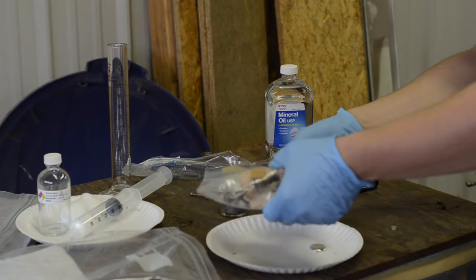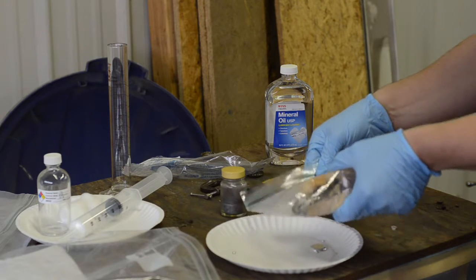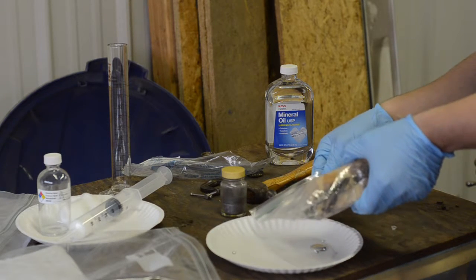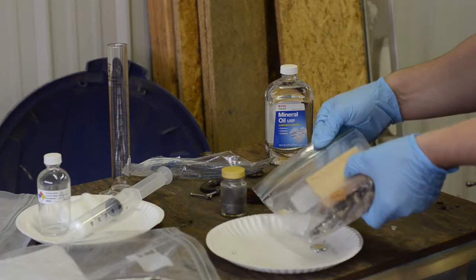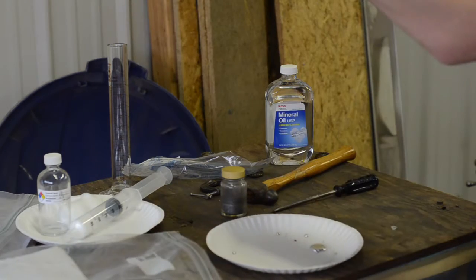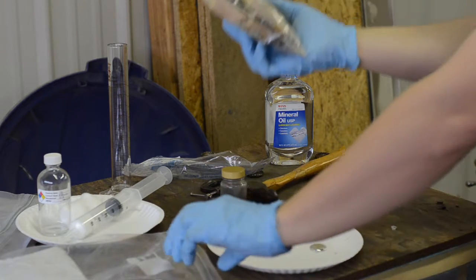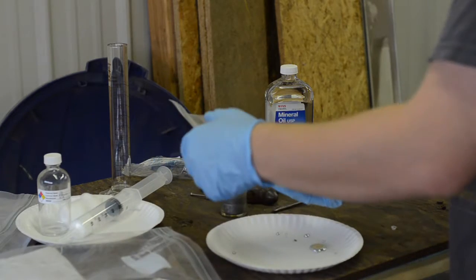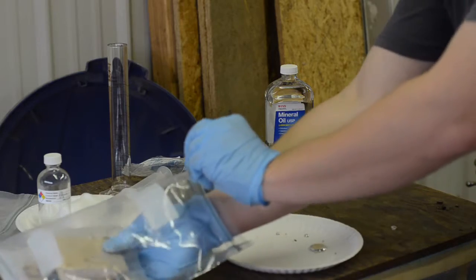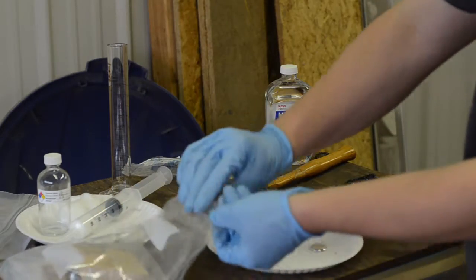And basically there's a bunch of places for it to hide in here. And so we're going to slowly go in all directions, in all orientations that we can get, until we get all the mercury out. One last look around here. There may be some more in there, but like I said, all of this is going into hazardous chemical disposal. So any mercury that's left in here will be disposed of properly.